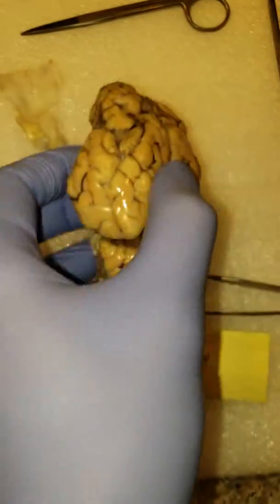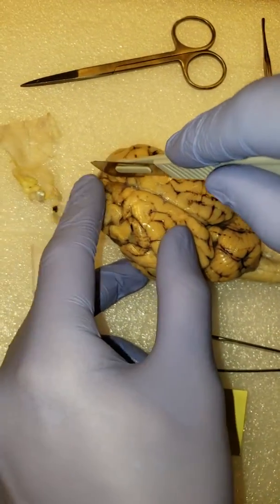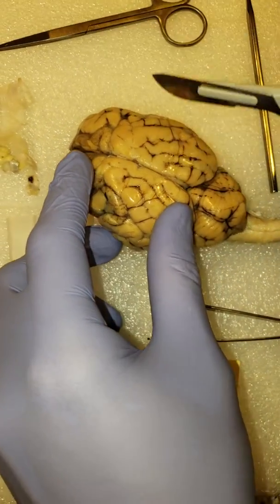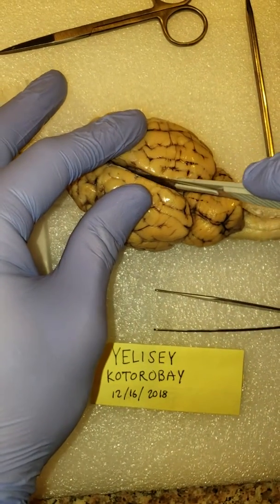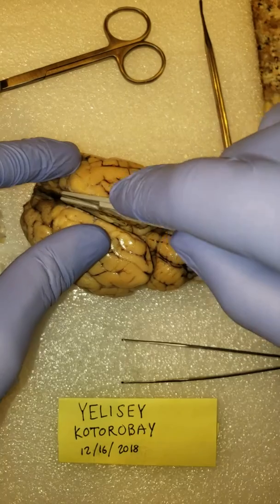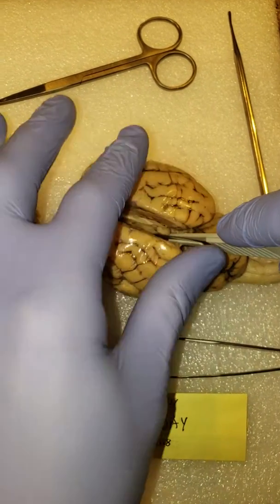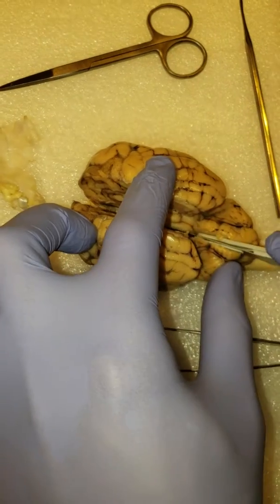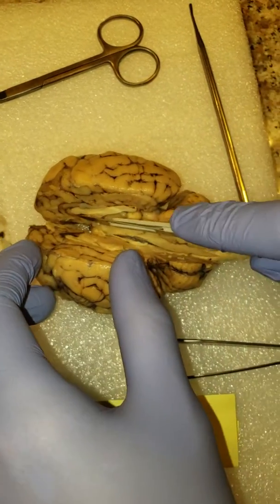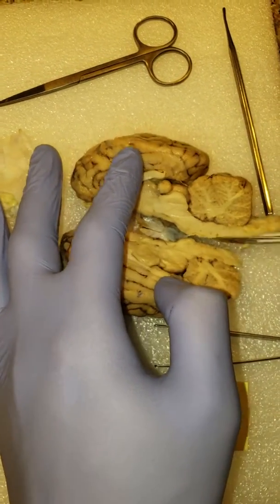Now the instructions also say you should take a quick look inside. So I'm going to bisect the brain right down the middle. Sharp scalpel. Just got to be really careful with these cuts. Not quite perfectly down the middle, but the stem was kind of off center in the first place, so that about does it, I think.